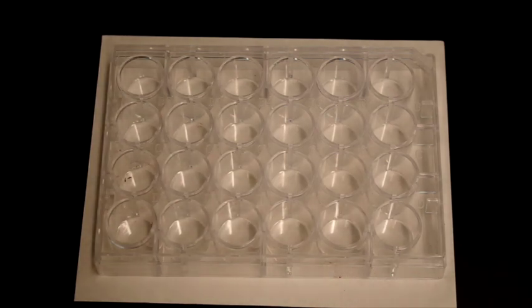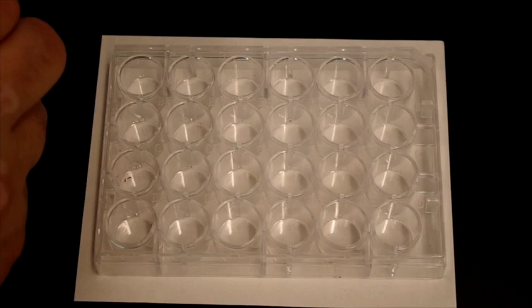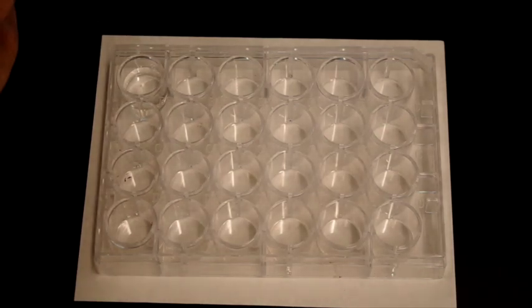So the first one is a dropper bottle of sodium chloride. We will place it in the upper left corner of the spot plate, like so. And we'll do 2 dropperfuls just so that we can have plenty of visual aid. So that was sodium chloride. Now we will add silver nitrate.